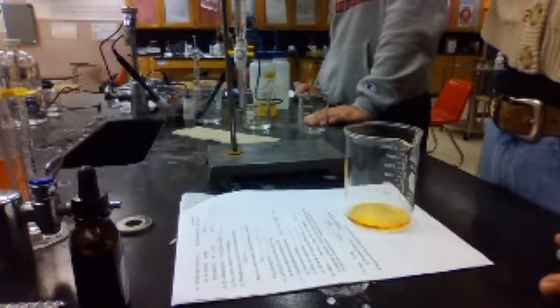Yeah. Okay, and then don't I take the initial volume of this? You should have taken the initial volume already. But it was at 0. Right, so the initial volume is 0.0. Okay, so the initial volume of the acid was 0.0, FYI, and then the initial volume of the base was also 0.0. Oh, I don't know about that one.